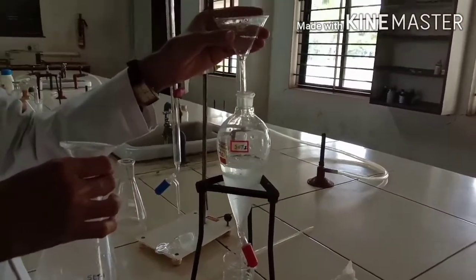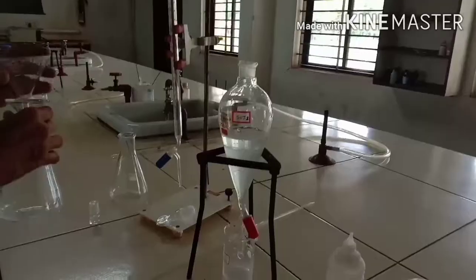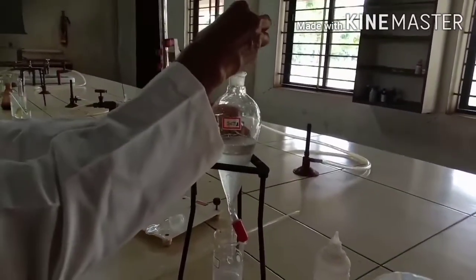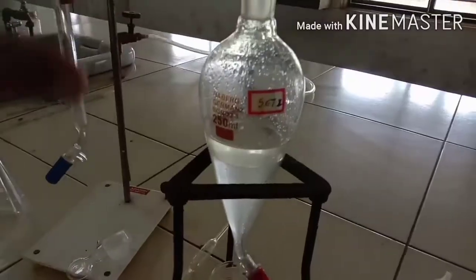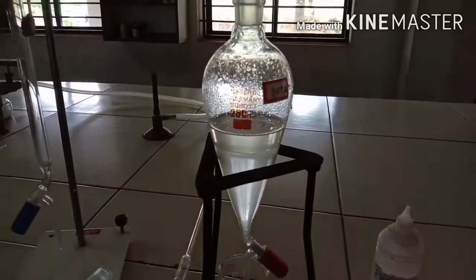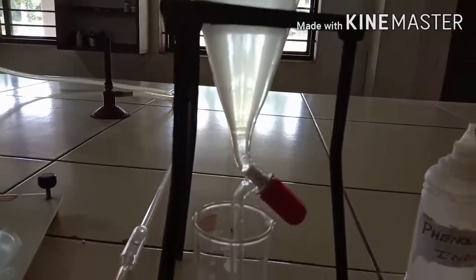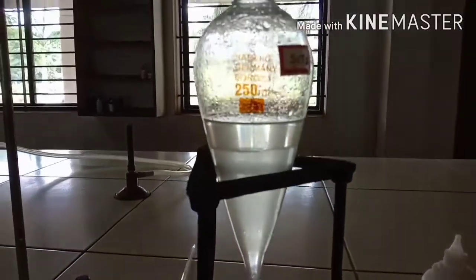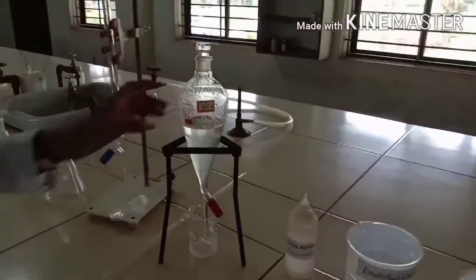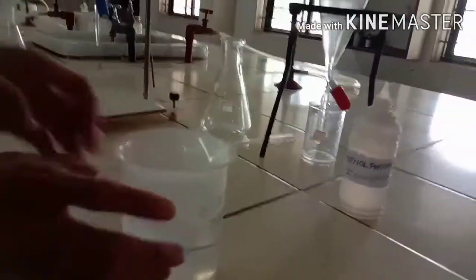Put the stopper and allow 20 minutes for both layers to separate. You can see the upper layer is benzene and the lower layer is aqueous. The density of benzene is very low, which is why it forms the upper layer, while the lower layer is aqueous.